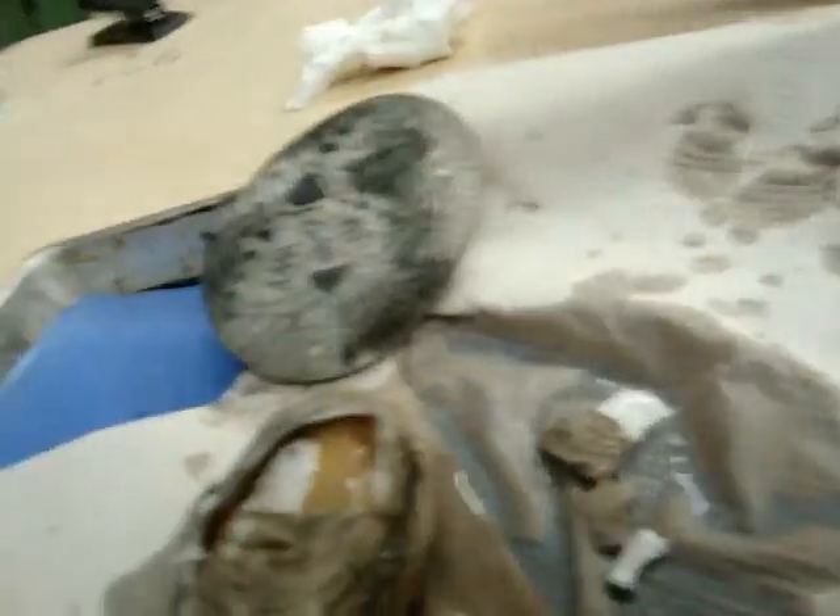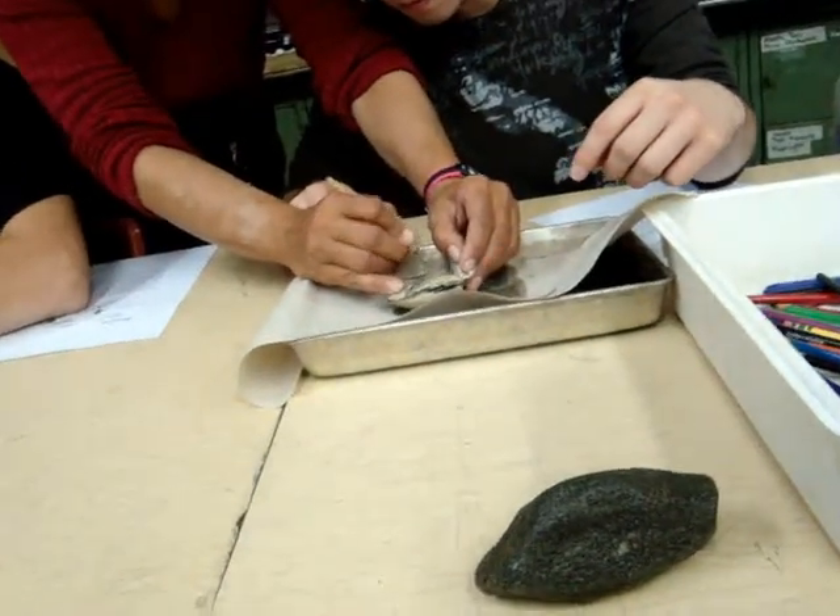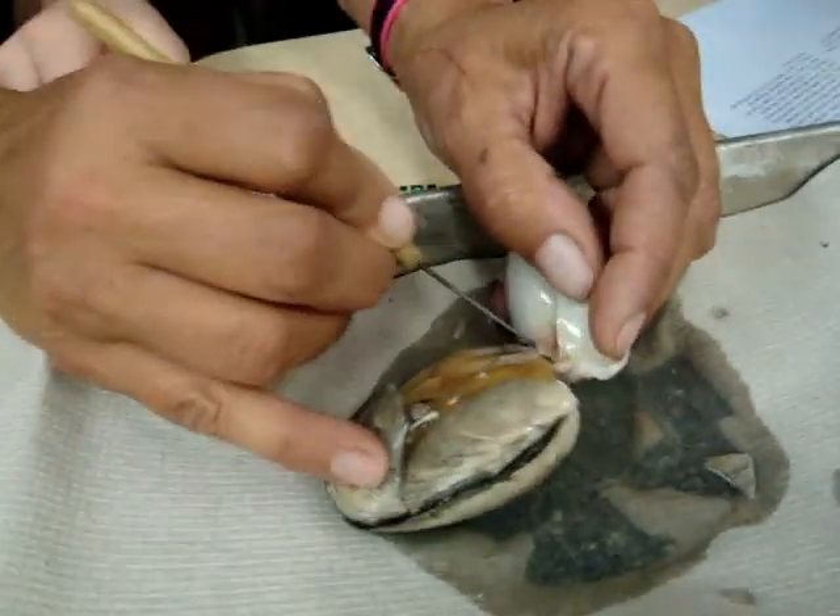Goggles, goggles, goggles. Cool story, bro. That muscle's right there. People drew on it. Scrape on the top of the shell — see? There you go. See, I scraped off that muscle. Alright, and just go like this. Yeah. Drain all of it.